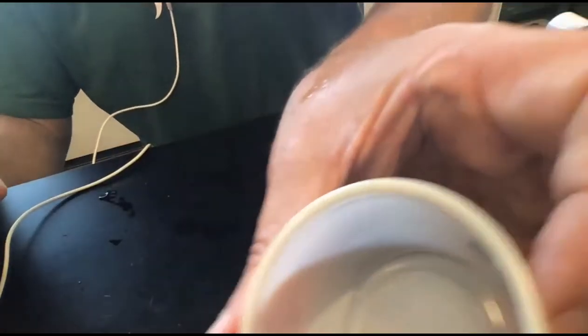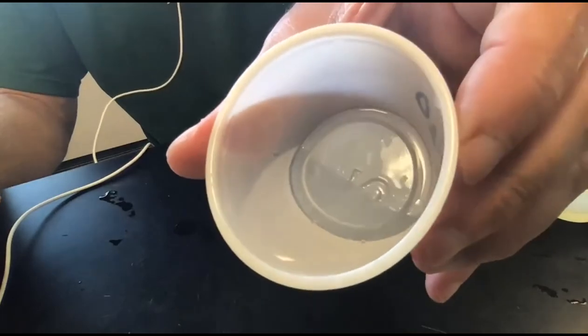In my water example, the oil stays together, separate from the water. I don't know how well those two particularly showed up on the screen. Probably not very well.